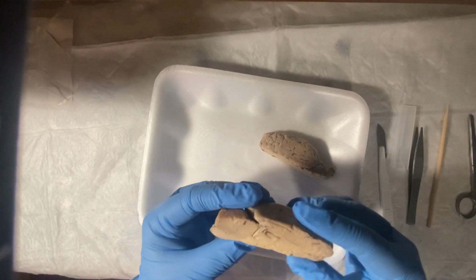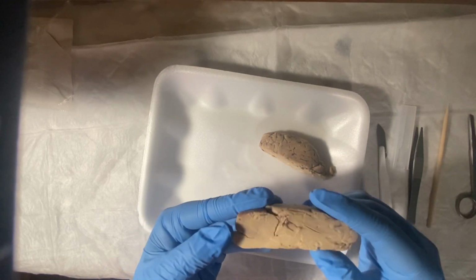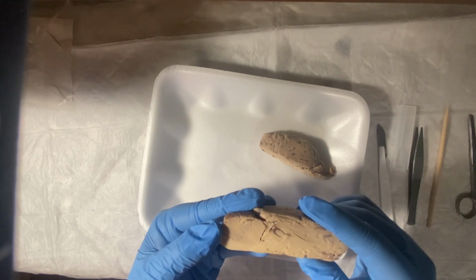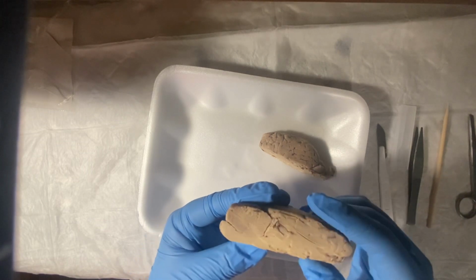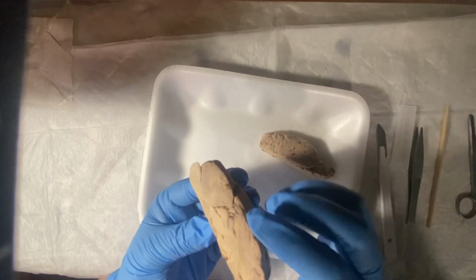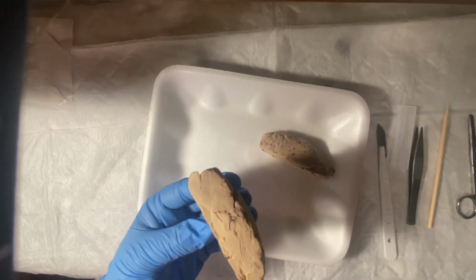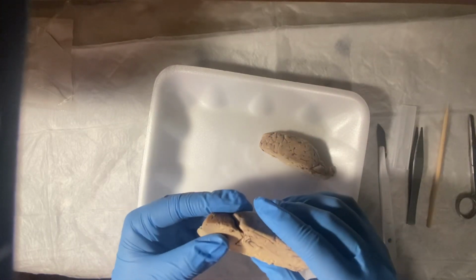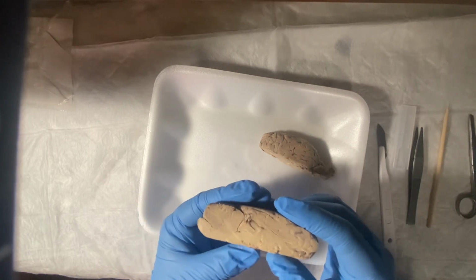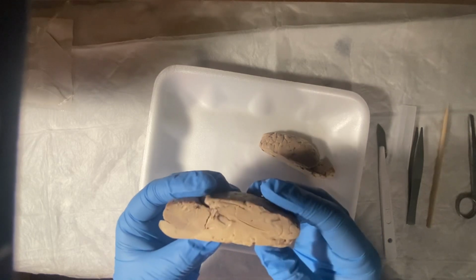And then of course the branch-like tree structures with the white matter, that's the arbor vitae, and that's just the tree-like structures. Let me try to get it in the light. Yes, the tree-like structures in the cerebellum. That would be the arbor vitae, and that's just the branching of white matter in the cerebellum, like I said. And I think that's about covered most of it in the brain.